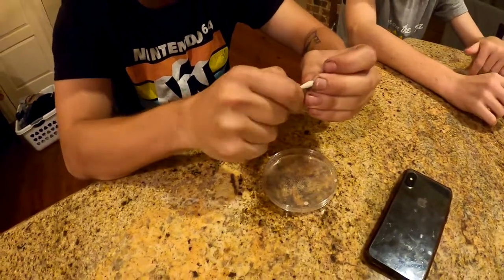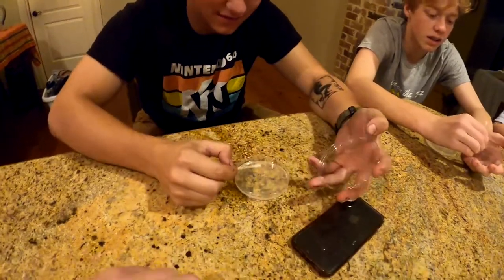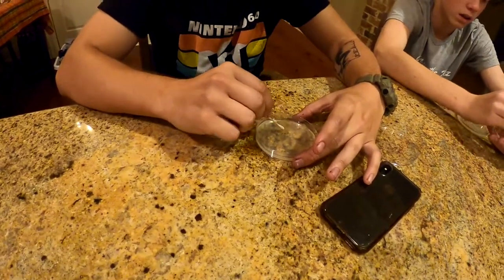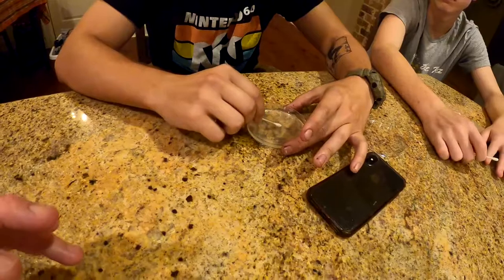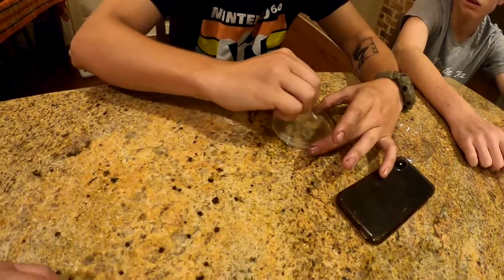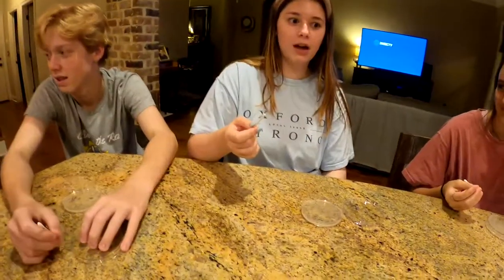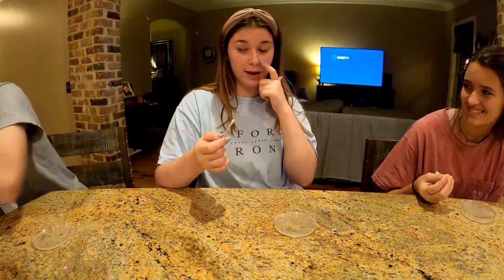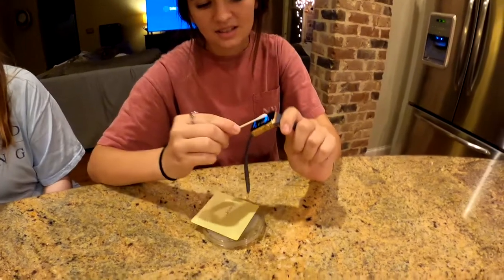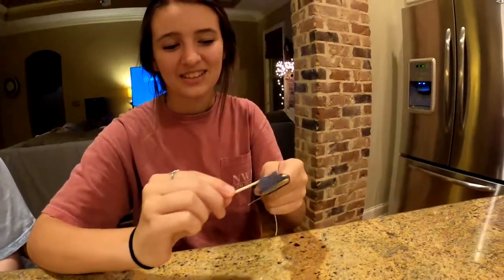One sample has airplane grease and other stuff on it. Rub the swab on the agar in a couple of different places. Others choose to swab their nose or their Apple Watch — it's probably so gross, one person says they don't even want to see what's on it.